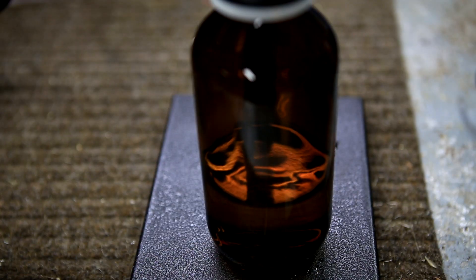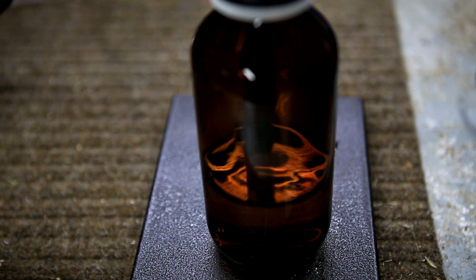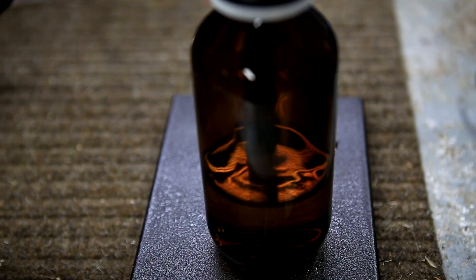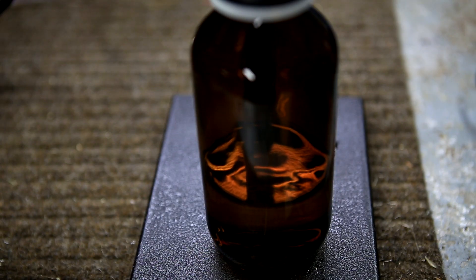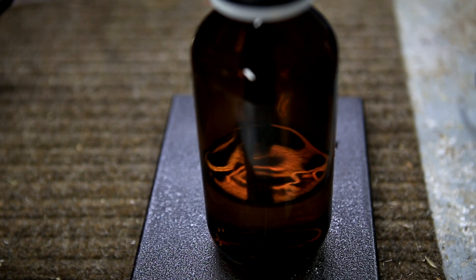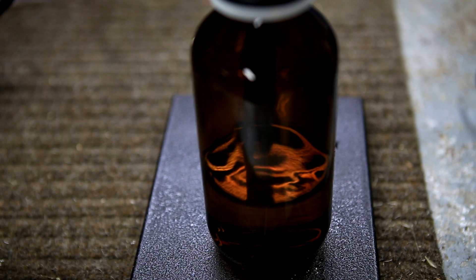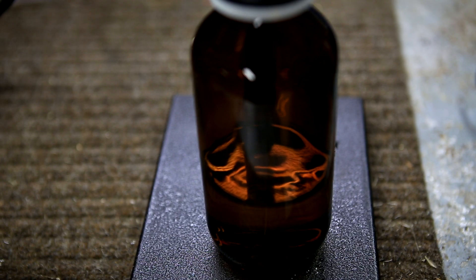The ether was then transferred to a dark bottle and the threads of the bottle were sealed with Teflon tape. Be aware that ether does form dangerous peroxides when stored for a long time. It is recommended to add a little bit of KOH or NaOH to prevent peroxide formation.